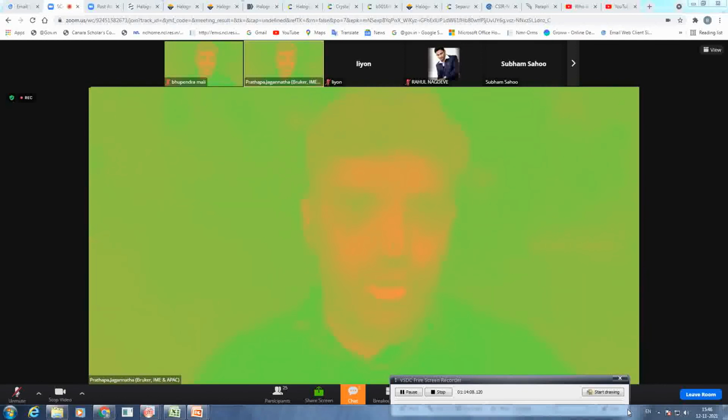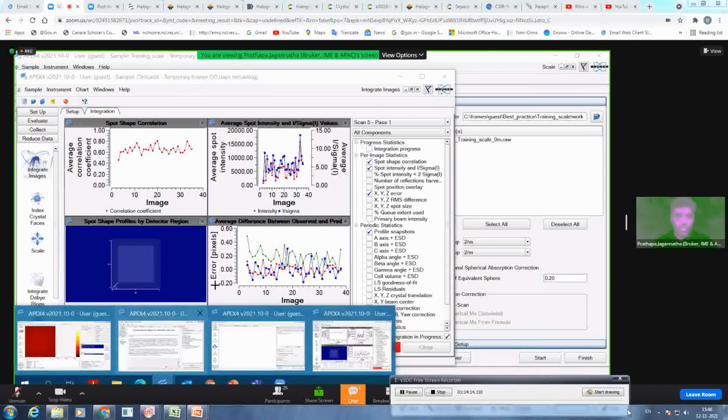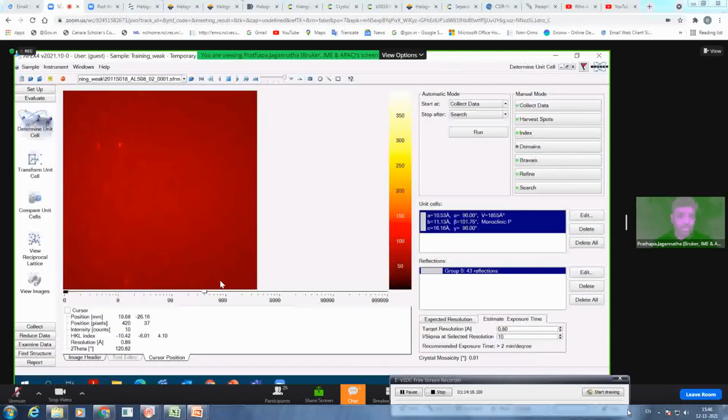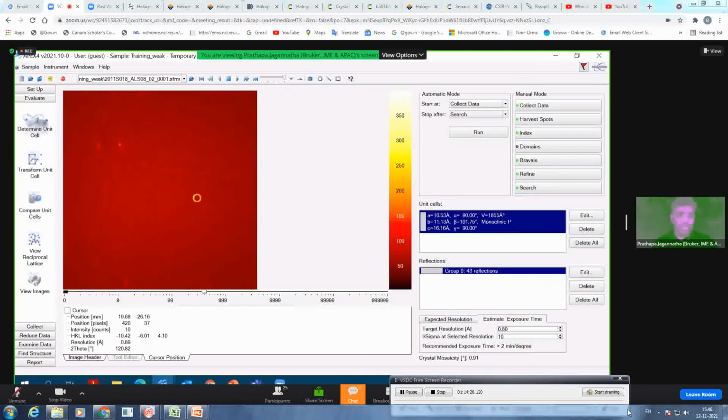Let me share my screen. Okay, I hope I'm sharing again, sorry. So I have another dataset here to show for the demonstration. In this case we have not shared this data because it's customer data, which is a bit confidential.